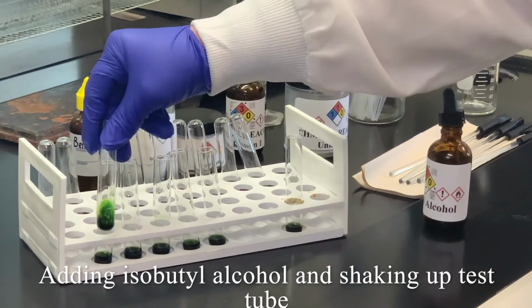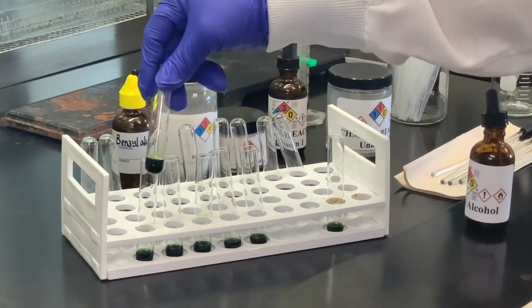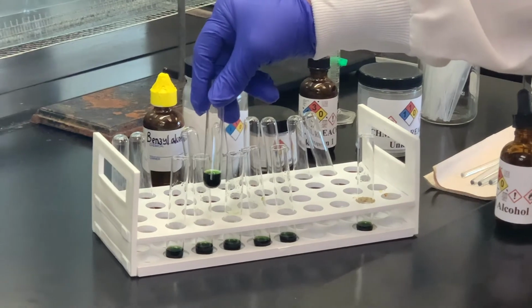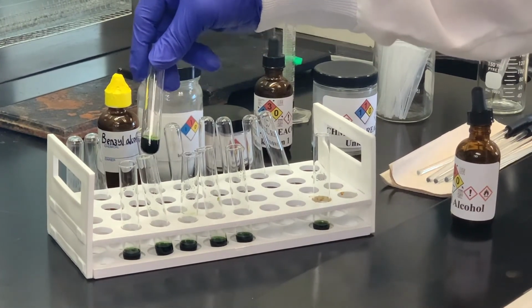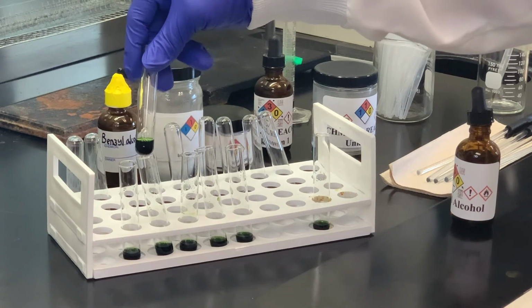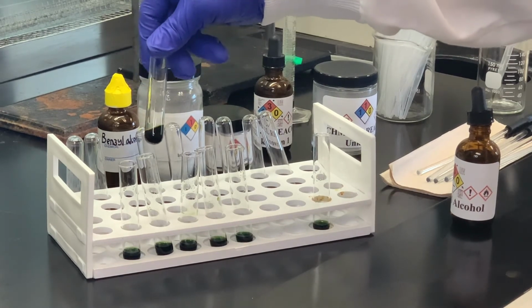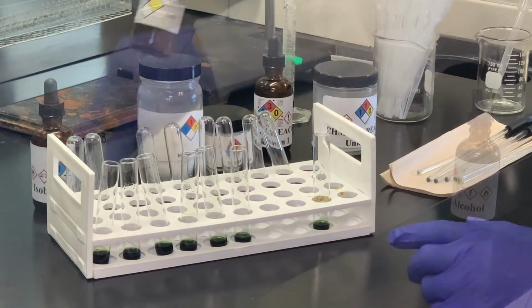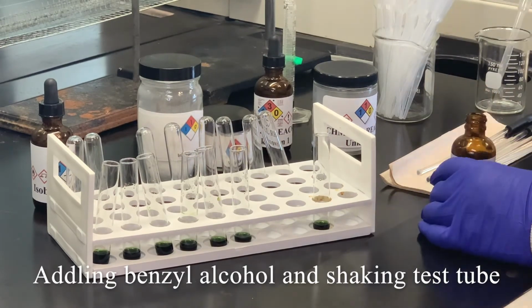Now, if there's no change in the color, we're assuming that the substance we have is such a weak acid that there's no really significant amount of change to cause a change in the color. And alcohols generally have about the same pKa as water. We don't think of water as being acidic, so it shouldn't surprise us that we don't really see a change in that test tube. The next alcohol we're going to use is benzyl alcohol.